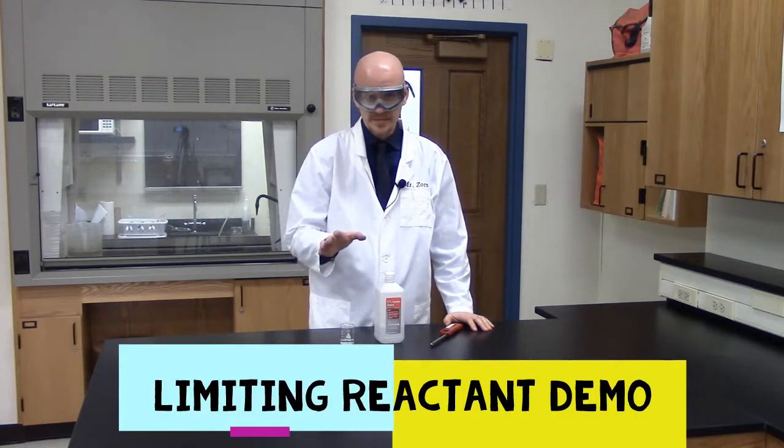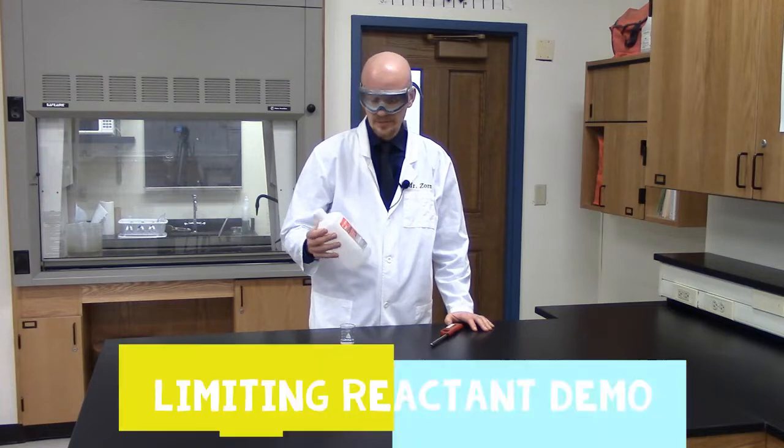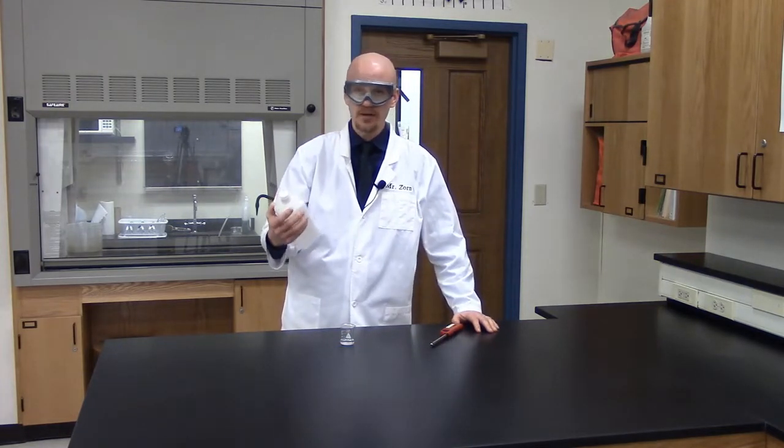All right, this is a limiting reactant demonstration. So I have isopropyl alcohol here. This is what you would buy at the store. This is 91% isopropyl alcohol.